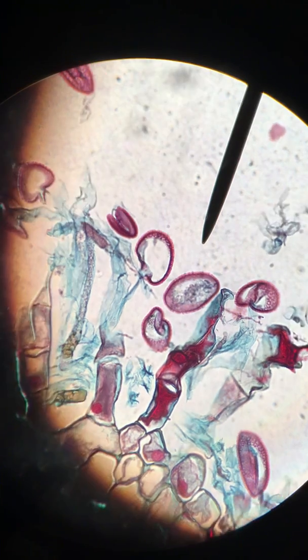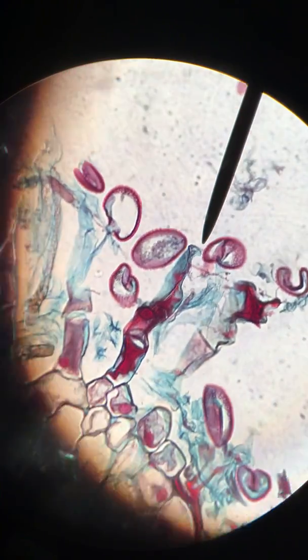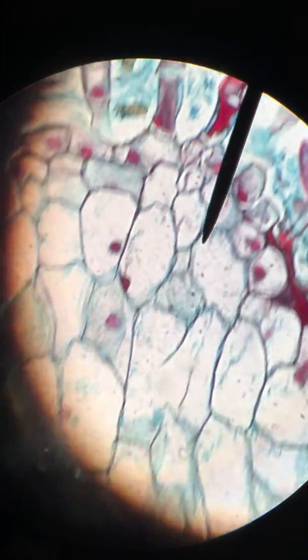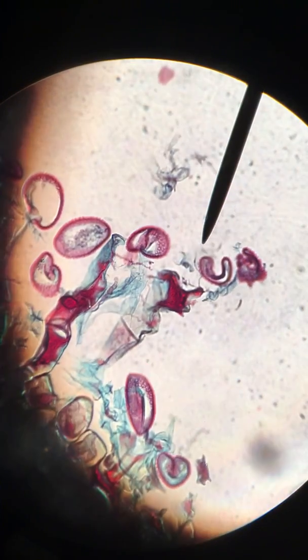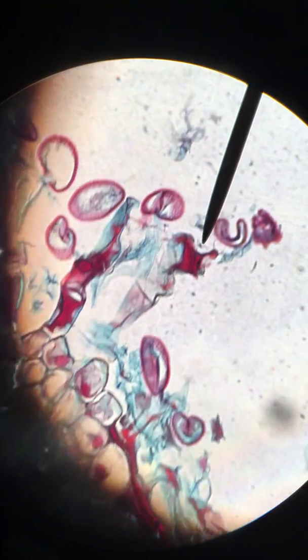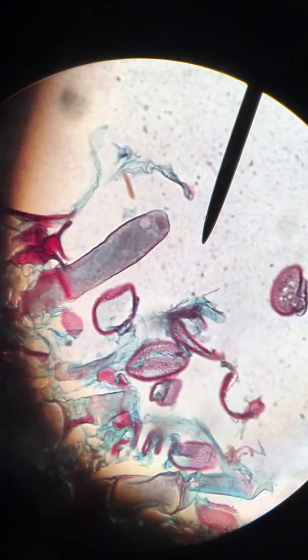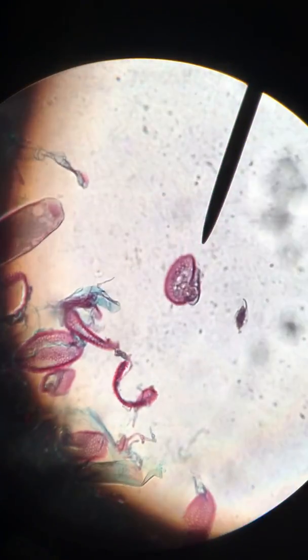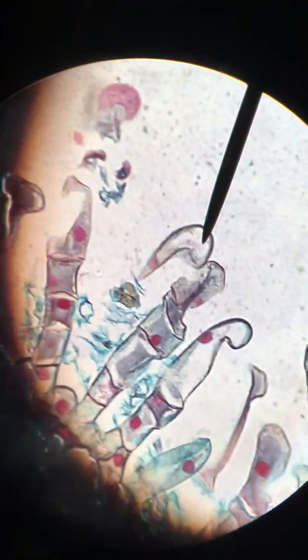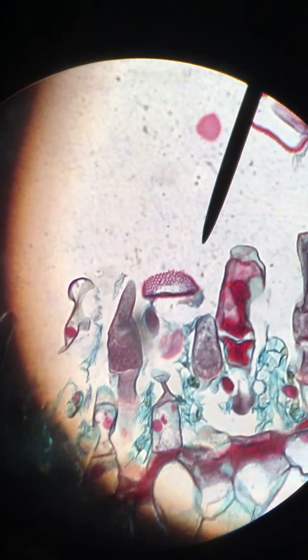And sure enough, it looks like we've got lots of pollen grains. They are meeting at the stigma, which of course will be down here. But they do look very similar in structure to the pollen grains that we saw on our last slide. And some of them may even have produced a tube. That one there looked like it might have, but there are a lot of pollen grains that have landed here in the hopes that one of them will be able to produce a new plant embryo.